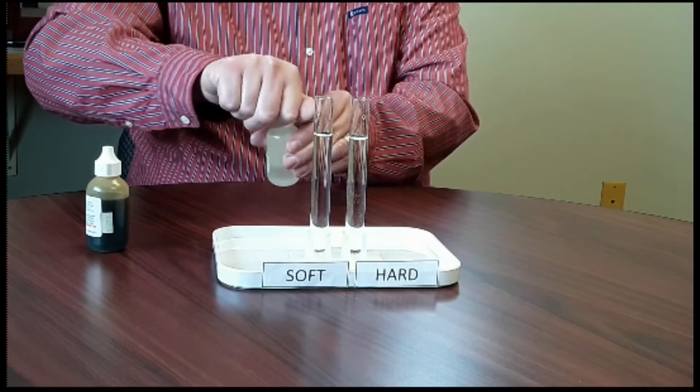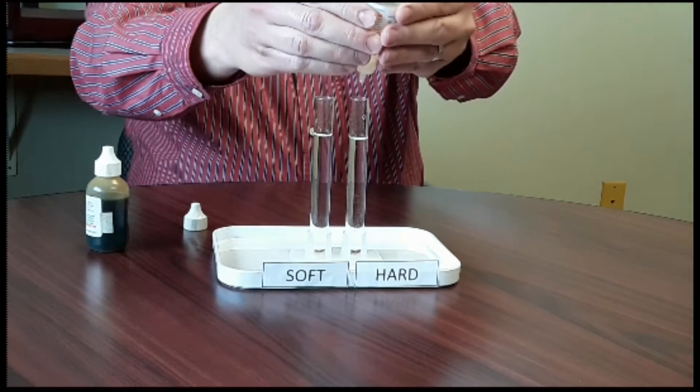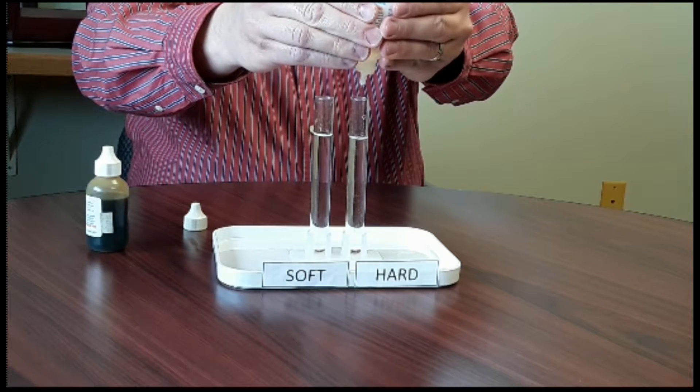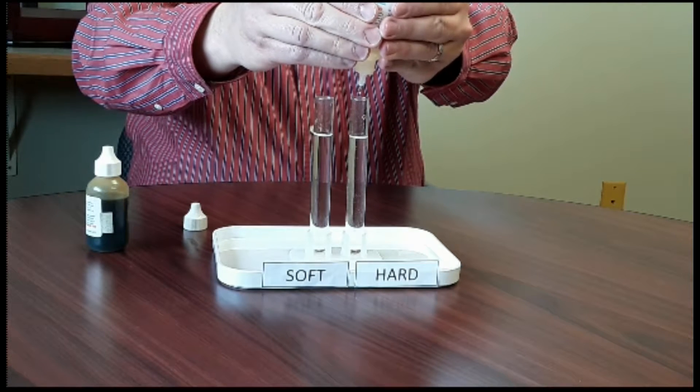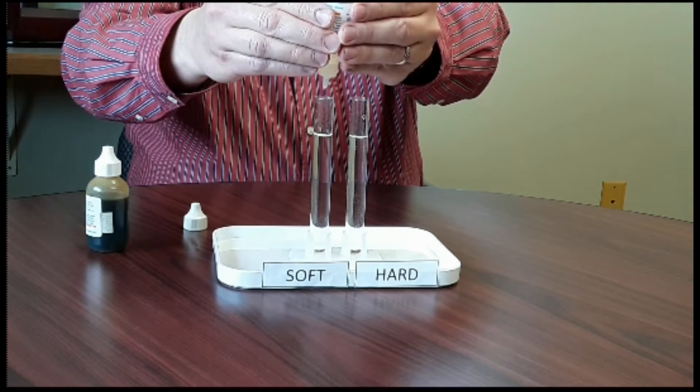We're going to start with the first solution, adding 10 drops to the hard water. Now we're going to move over to the soft water vial and add another 10 drops.